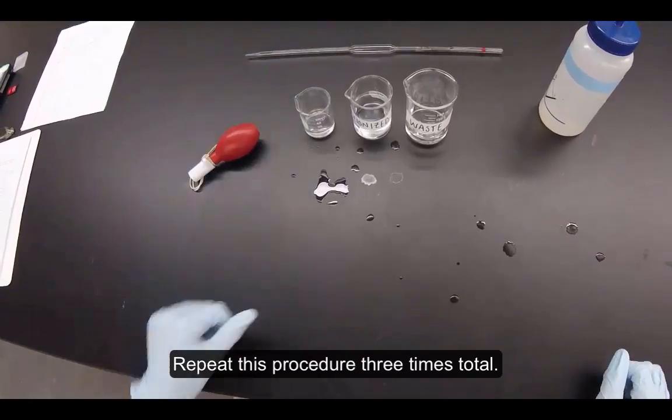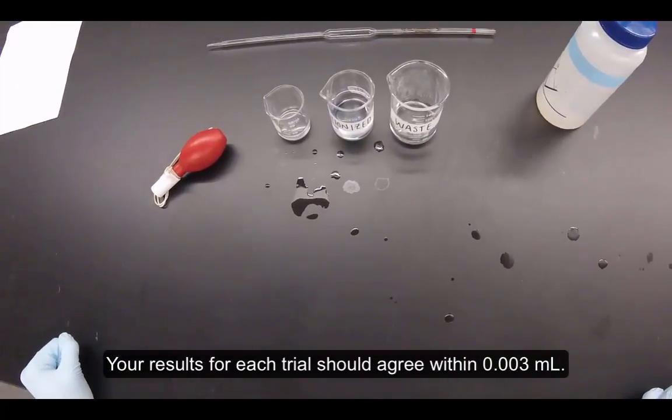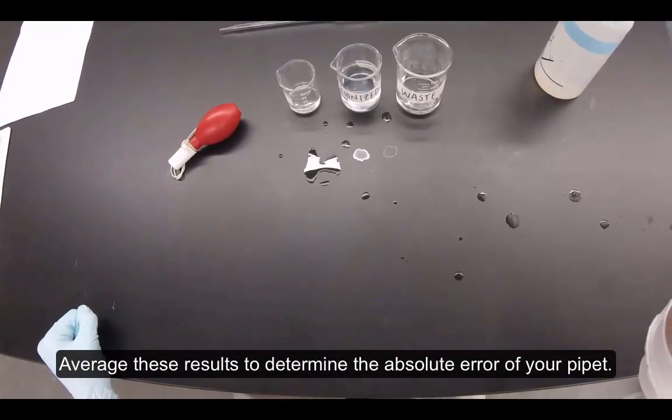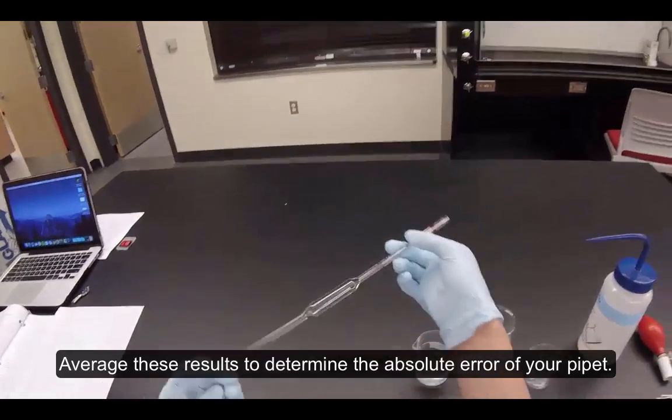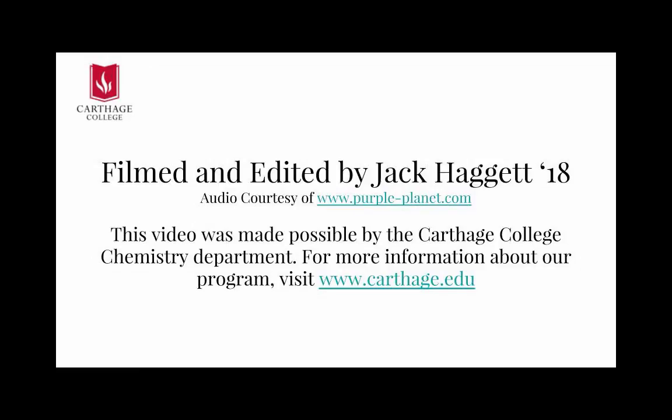Repeat this procedure three times total. Your results for each trial should agree within 0.003 milliliters. Average these results to determine the absolute error of your pipette.